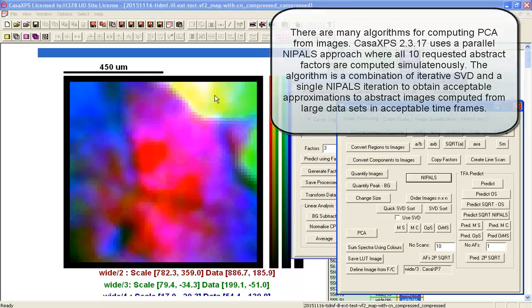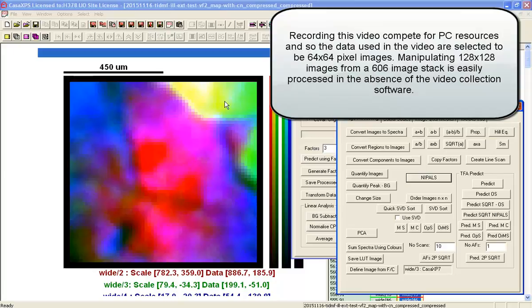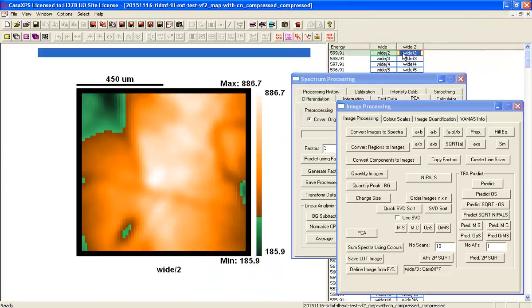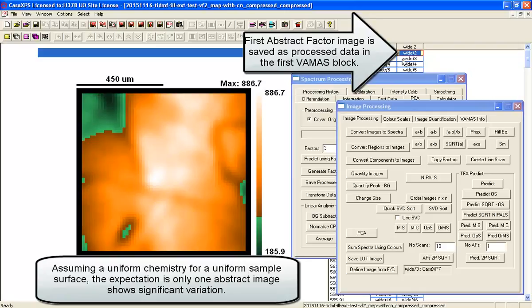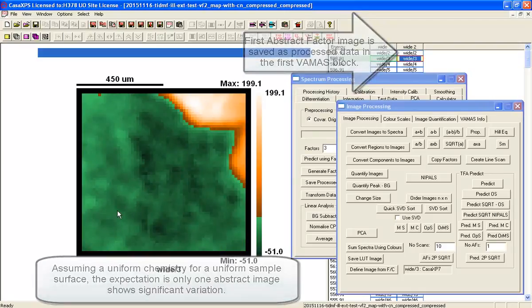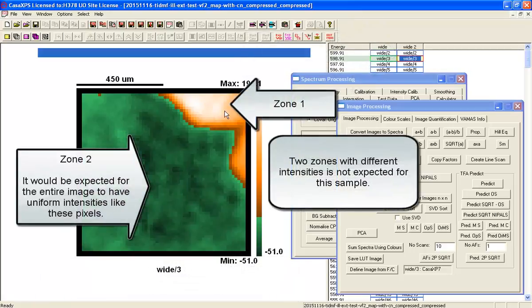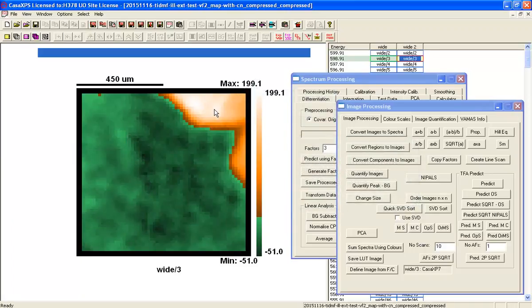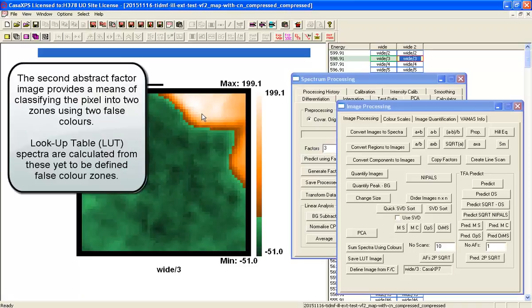The reason I've got 64 by 64 is for the video. It's competing with the acquisition of the video, so I would normally do this with a better pixel resolution. But I can already see here, that's the first abstract factor. The second abstract factor, this is partitioning in a way that is unexpected for this sample. This sample is not expected to have anything other than a uniform chemistry, so to see a structure like this as the second abstract factor is unusual.